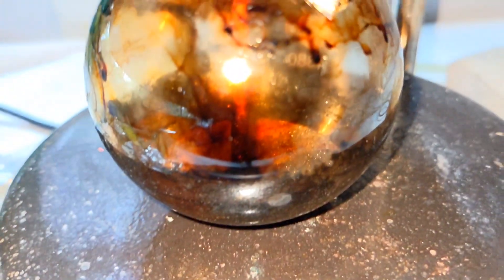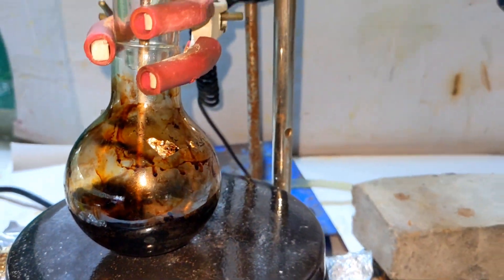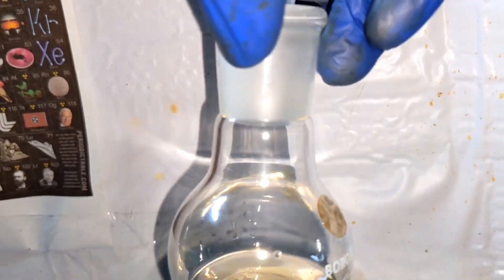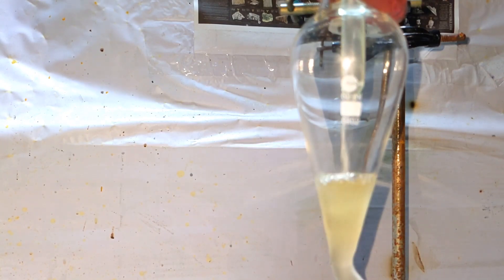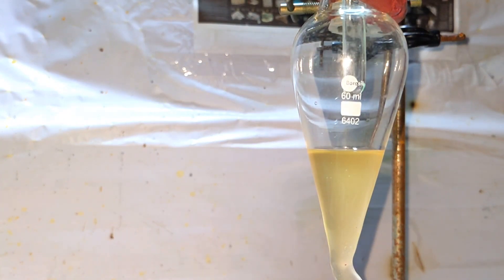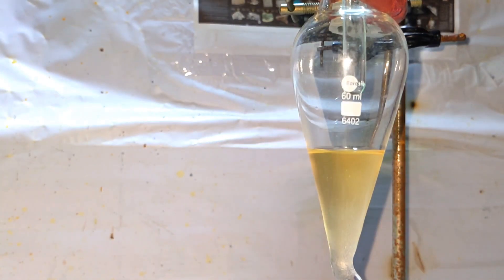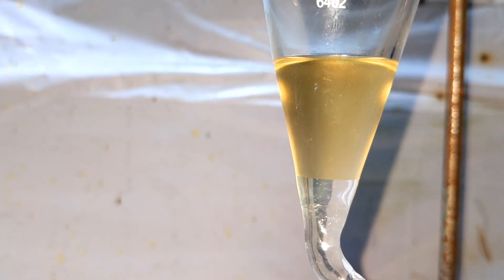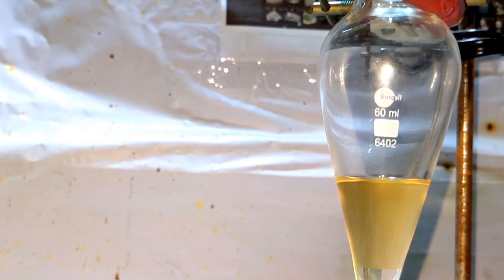Once the distillation is complete, the distilling flask is turned to a black viscous mass, which is easy to clean with piranha solution. In the receiving flask we have cyclopentanone with some water. It was then poured into a separatory funnel — cyclopentanone is not soluble in water and its density is less than water, so it forms the top layer. Keep the funnel for a few minutes so the layers separate, then discard the bottom layer containing water and water-soluble impurities.